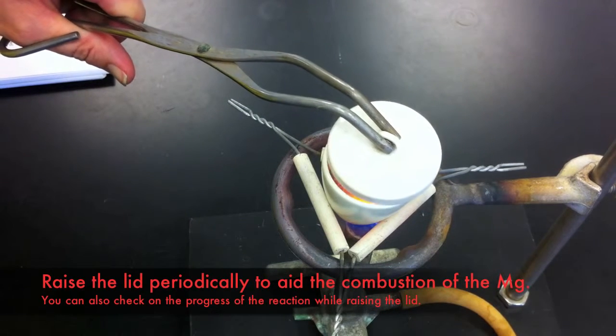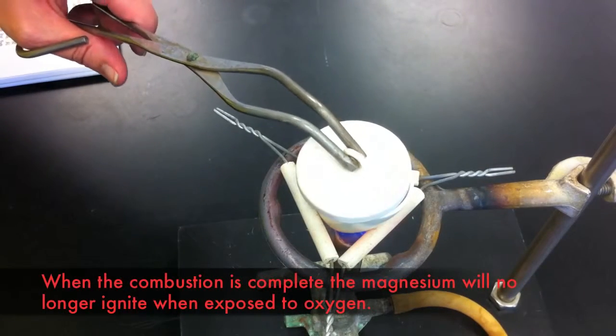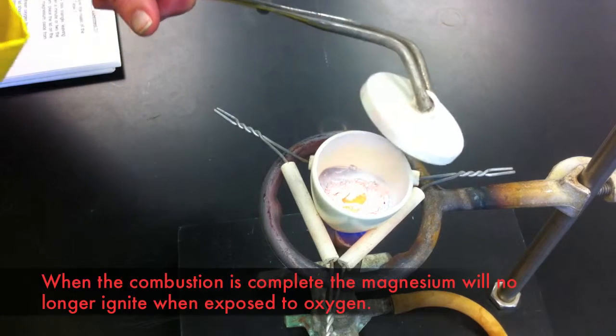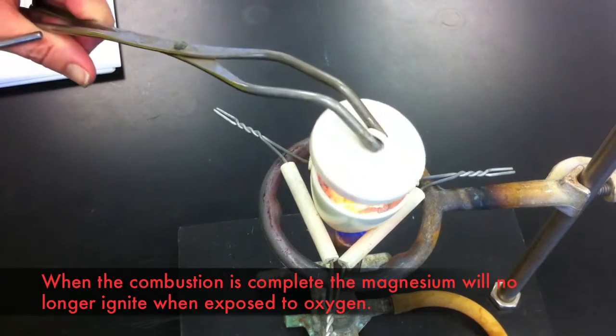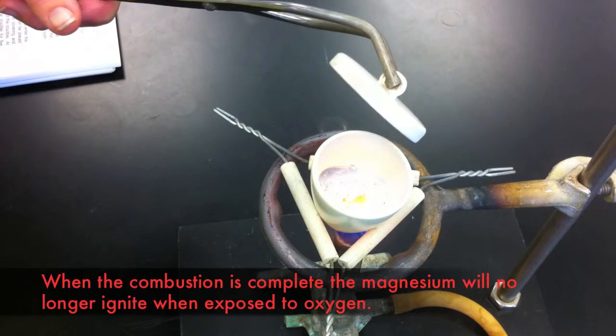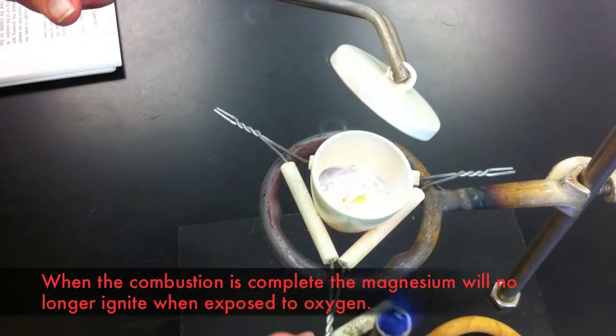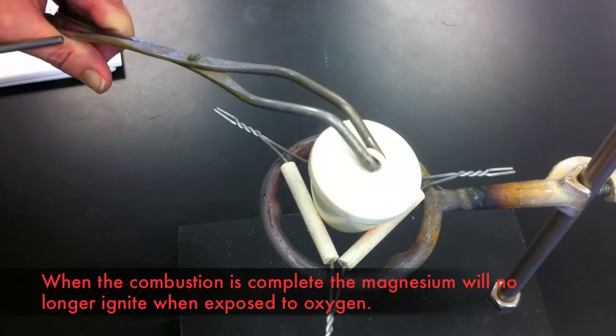Allow the reaction to proceed, periodically checking on it to see whether or not ignition occurs when the lid is raised. When ignition finally ceases, you know that the reaction is done. At the moment you can see that this is still glowing hot, but no ignition is taking place, so we know that the reaction is done. You can turn off the Bunsen burner and leave the crucible to cool. Allow it to cool completely before proceeding with the next step.